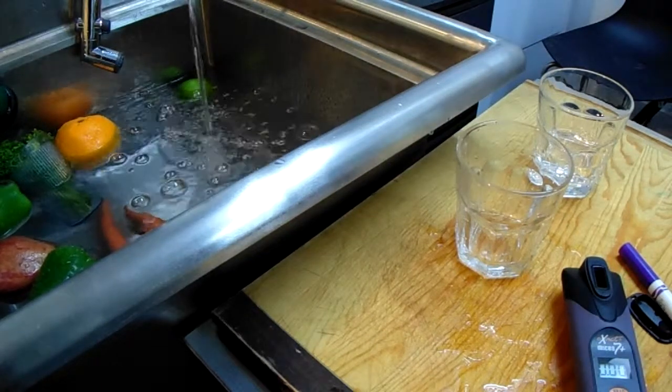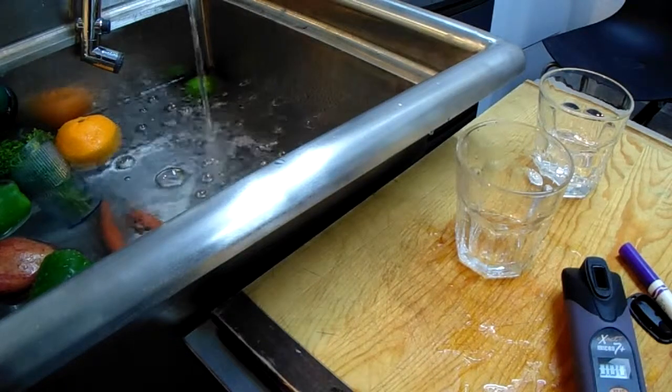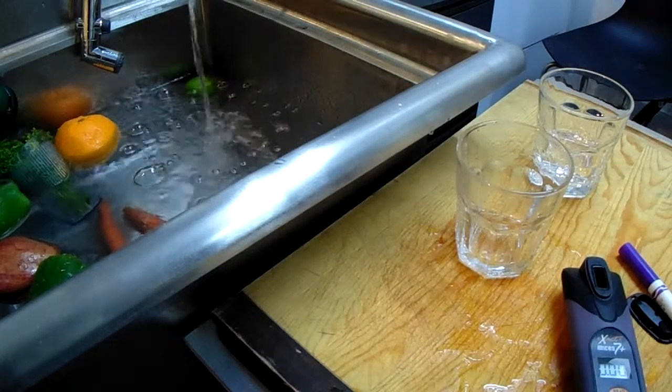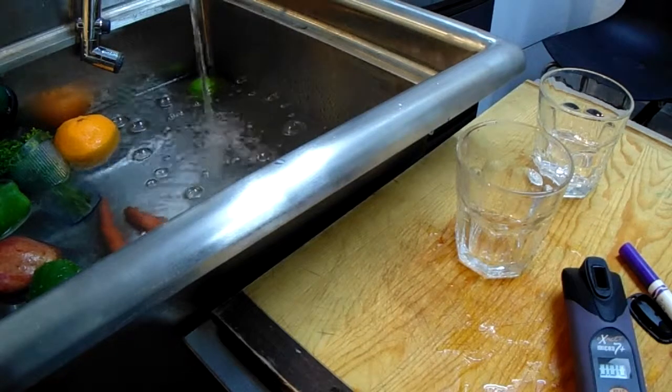In this video I will demonstrate how to use a meter to display the parts per million of dissolved ozone in water.